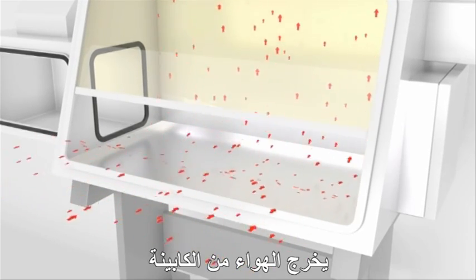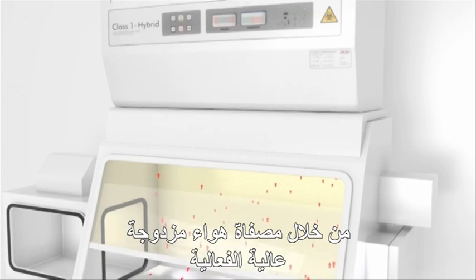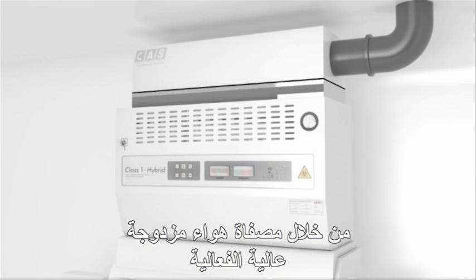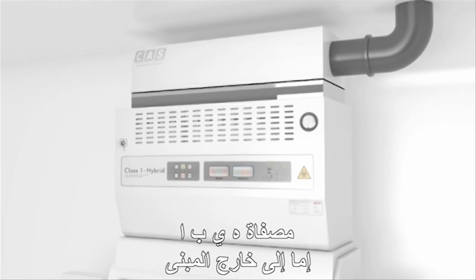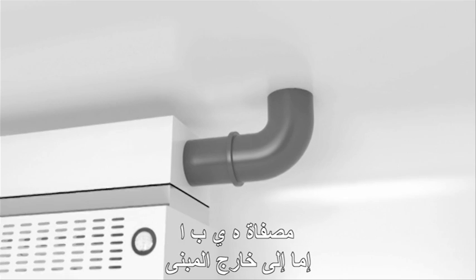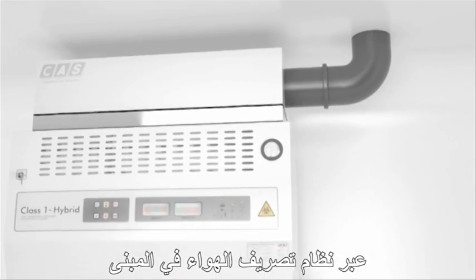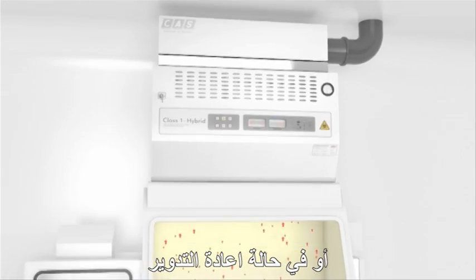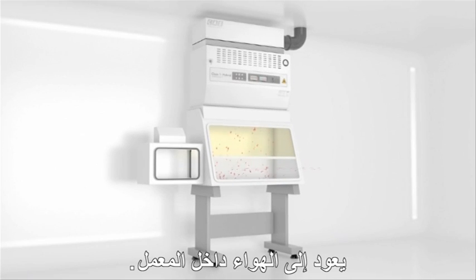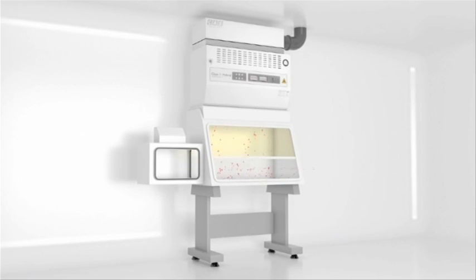The air from the cabinet is exhausted through double high efficiency particulate air filters — HEPA filters — either to the outside of the building through the building exhaust system or, in the case of a recirculating type, back into the laboratory airspace.